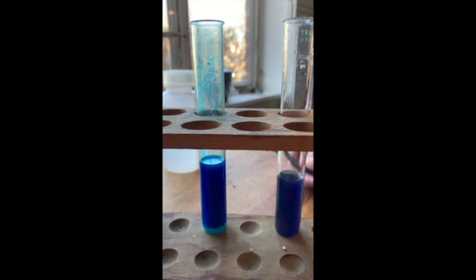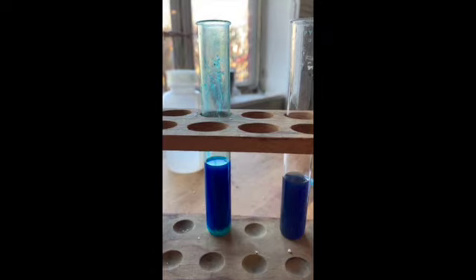The next stress we're going to do is add water to the system. Notice on your lab — water is a product in this system. So we are going to add water and let's see what happens.